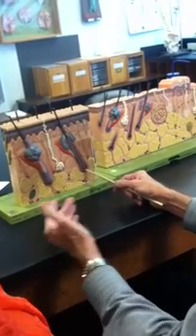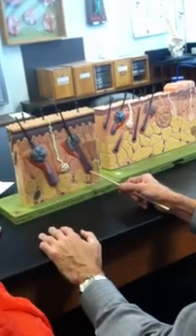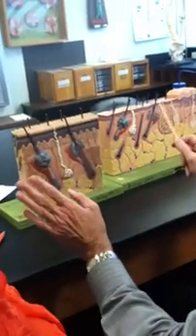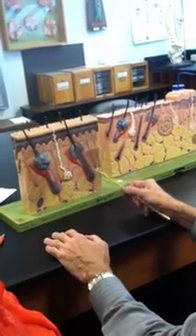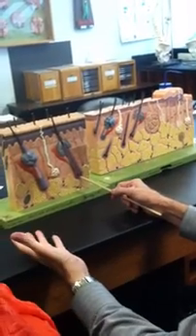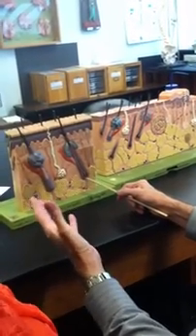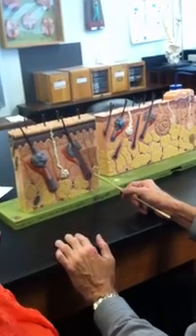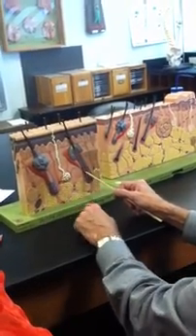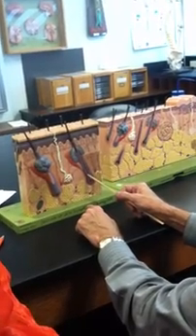The capillaries are providing the oxygen to, and moving the CO2 from, the hair follicle. It's a living organ. The hair root and hair shaft, that's dead. But the hair follicle itself is a living organ, and it's in two tissue layers. To be an organ requires at least two distinct tissues. The two tissue layers are the outer external root sheath and then the inner pink internal root sheath.